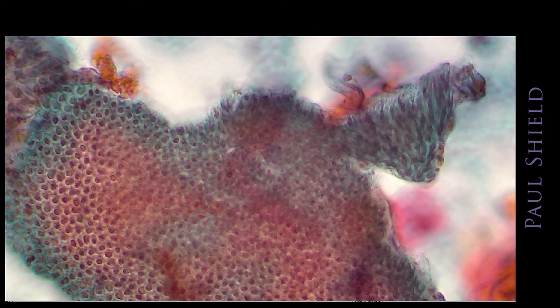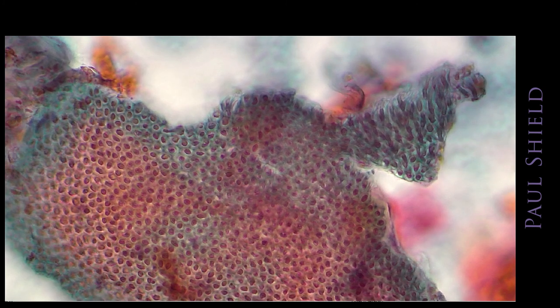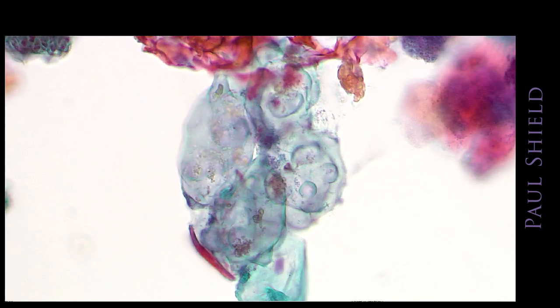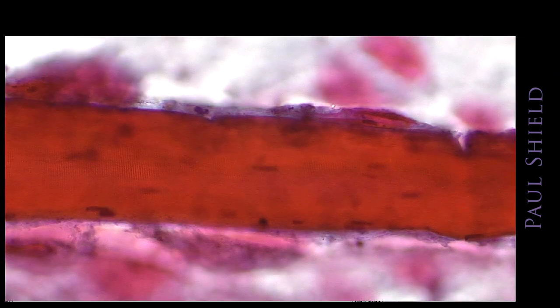They have nuclei that don't have a chromatin pattern, and these vary enormously in appearance. Sometimes that group, they can look a bit like squamous or squamous metaplastic cells. Here's a few more here that don't seem to have a nucleus. And to go with that, you often will see this. Guess what this is? So this is striated muscle. So this is meat that has been eaten. You can see the little striations, and so it looks just like skeletal muscle from a human. So that's the meat to go with the veg.